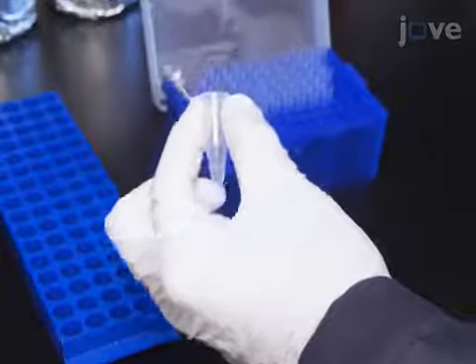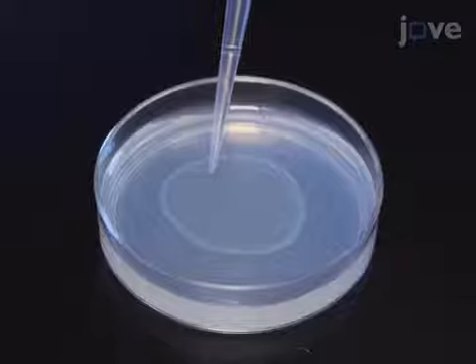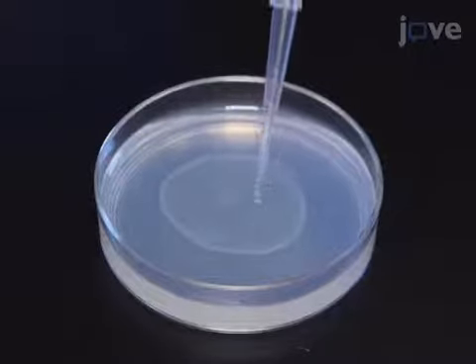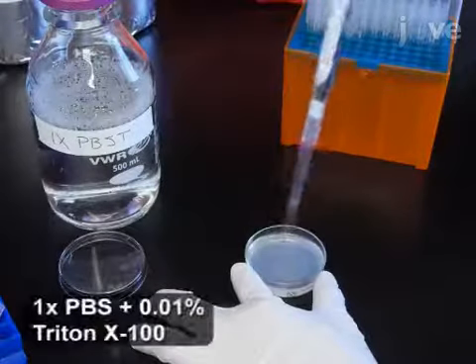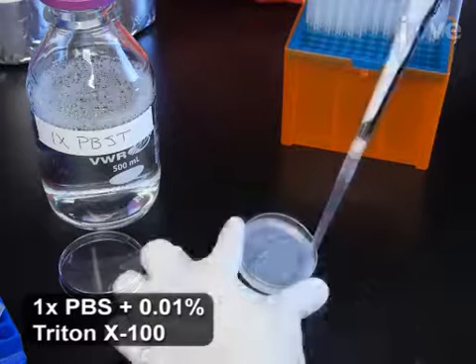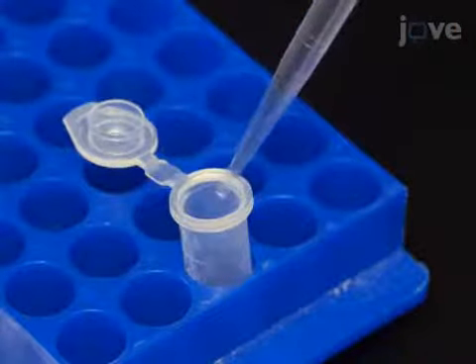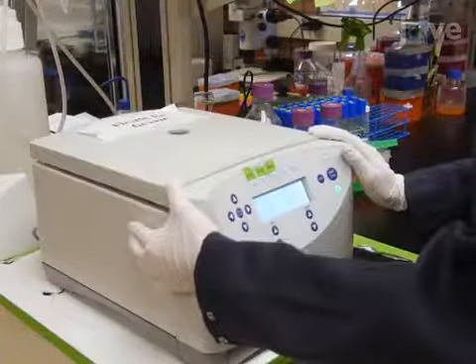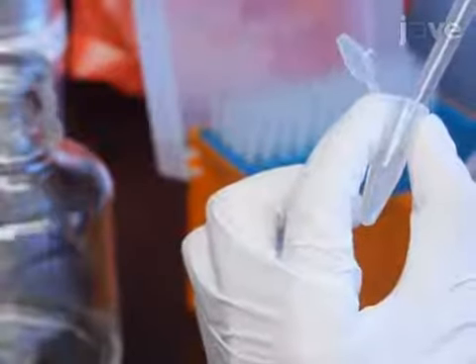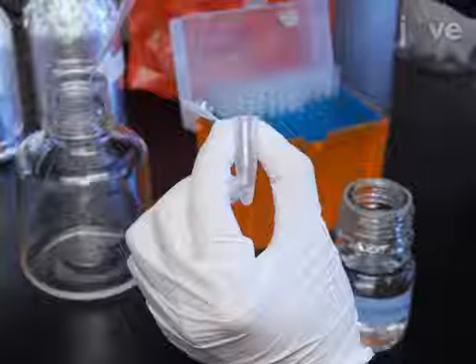To carry out Nile red lipid staining, plate worms on nematode growth medium, or NGM, seeded with late log OP50 E. coli, and grow the worms at 20 degrees Celsius to early L4 stage. Wash the worms with 1 milliliter of PBST solution and transfer the worm suspension to a 1.5 milliliter microfuge tube. Centrifuge the worms at 560 times gravity for 1 minute. Then remove the supernatant and repeat the PBST wash until the E. coli is cleared from the suspension.